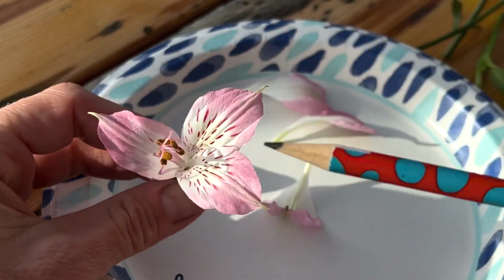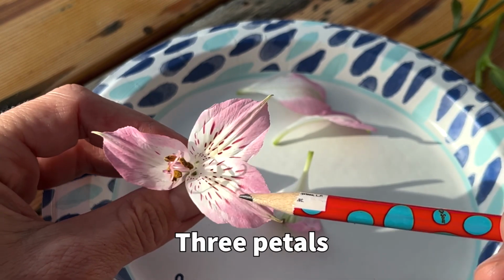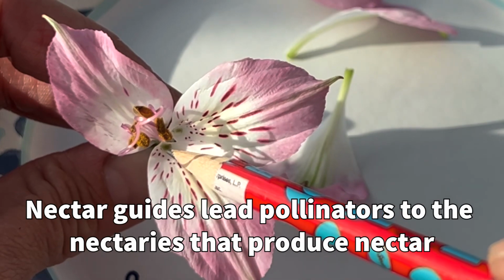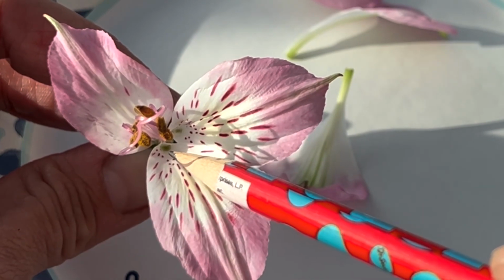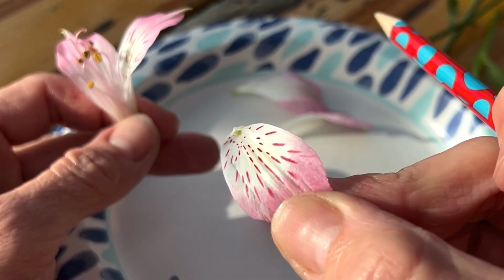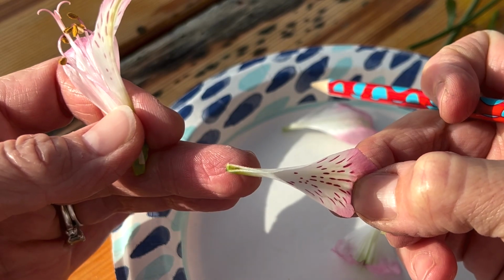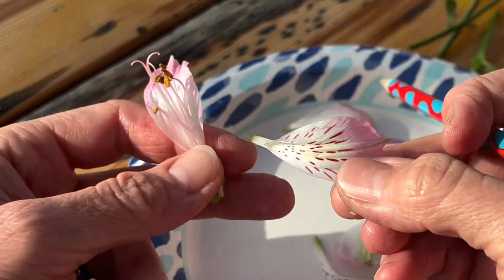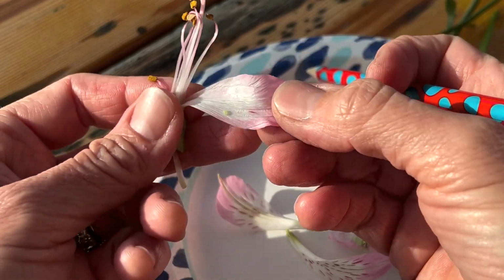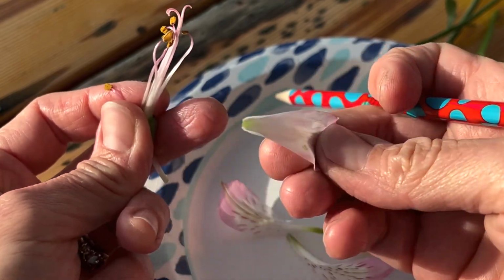The next thing we have are these 3 petals. You'll notice on these petals that they have these lines on them. These are called nectar guides, and they lead the pollinator down into the nectary. If you pull that off, you can see deep down inside is the nectary, right on that part there. So I have 2 of those, and then I have one more piece that does not have a nectary on it, which is that one.